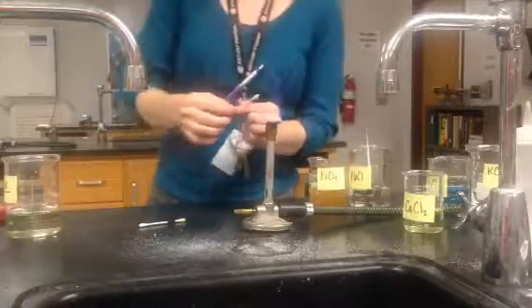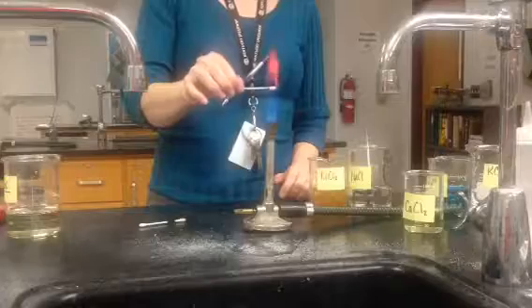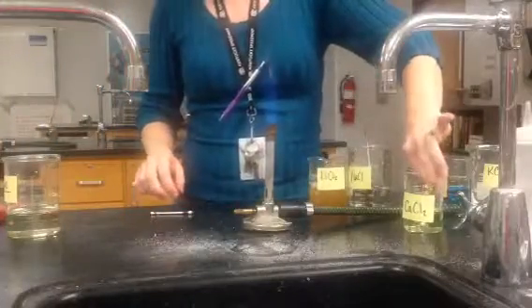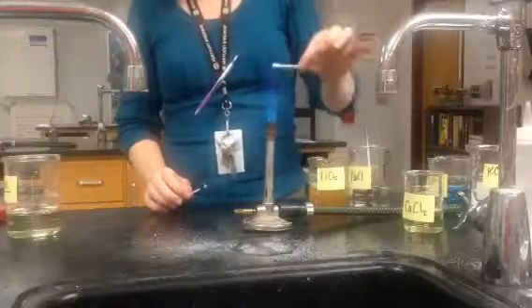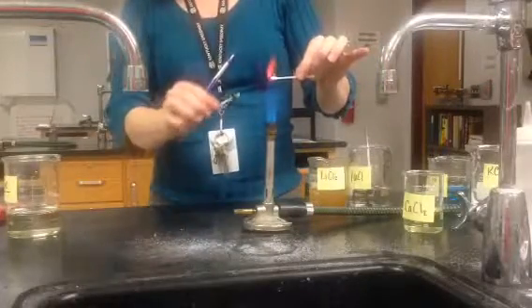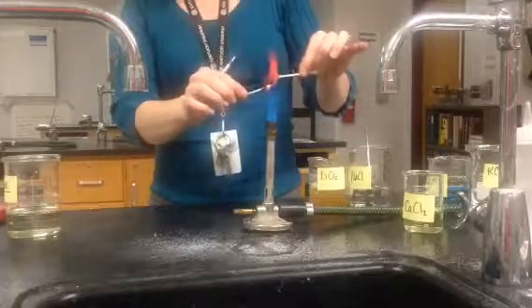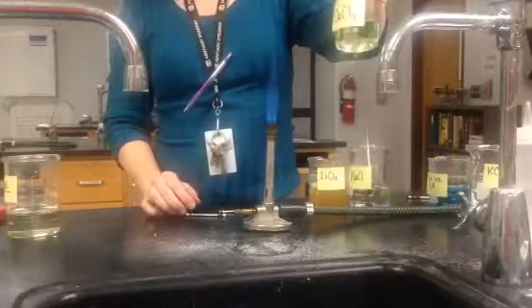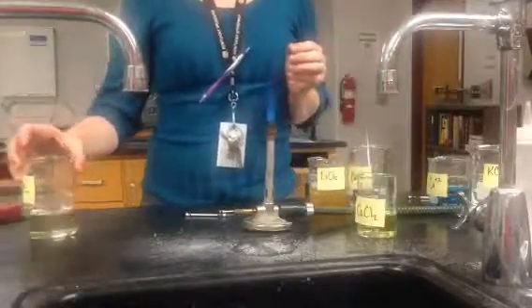Let's run the unknown one more time. Here's your unknown. Now let's look at the calcium chloride again. Here's your calcium — here's your unknown. You'll notice they're identical. So we now know that what killed our classmate was the calcium chloride, because they have the same spectrum, which is like our fingerprint.